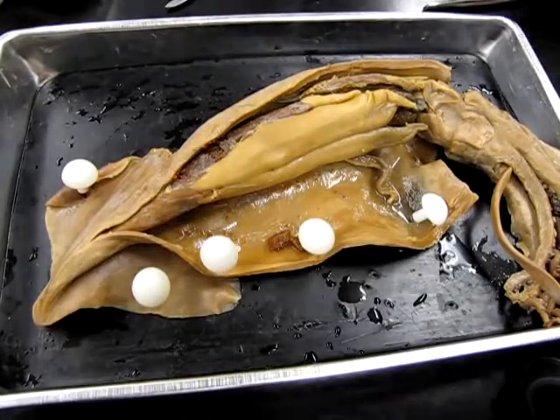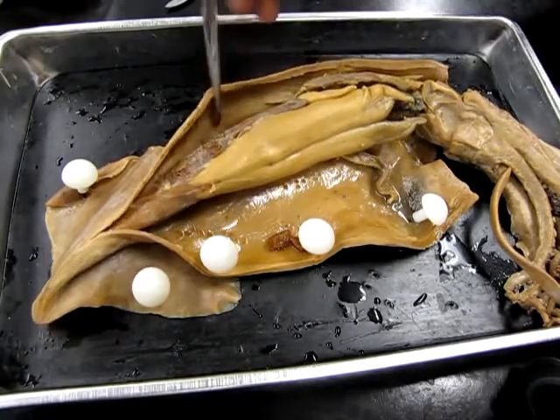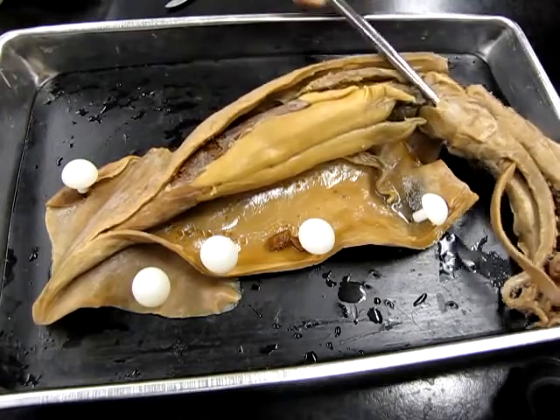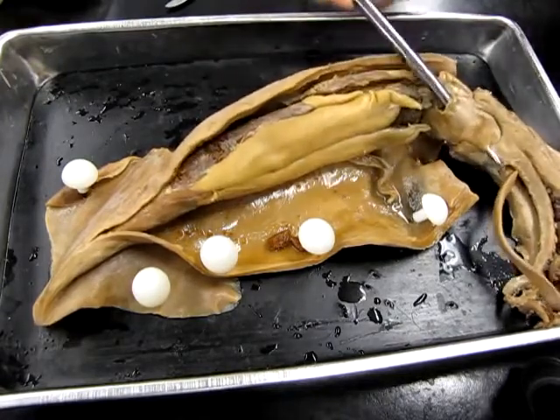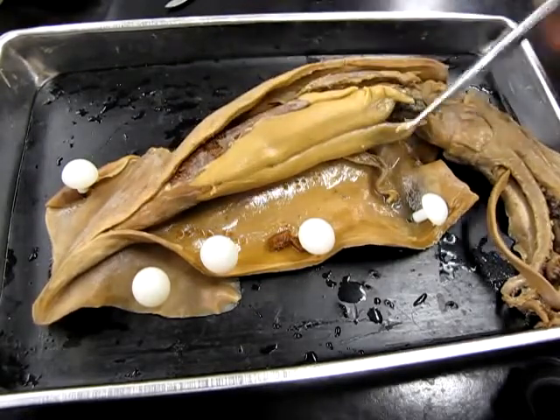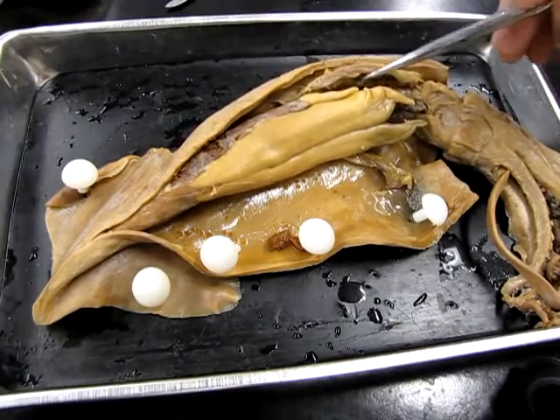Okay, so here's the female squid. I won't show too many of the same structures that we just saw in the male, but I'll orient you again. We have the siphon down here. It's a little more squashed. This one's a little older specimen. It's been preserved a little bit differently, and that's why the color is different. We can still see the gills here and up here.